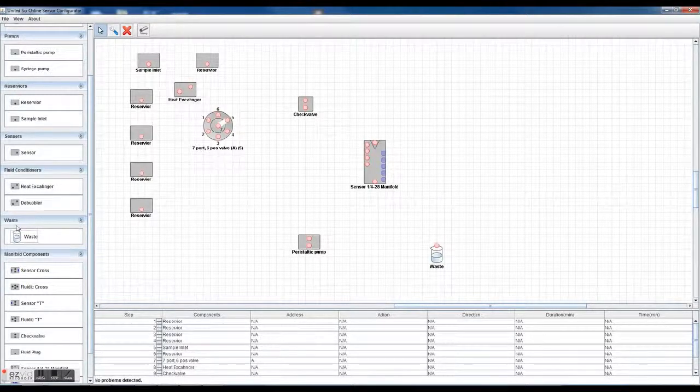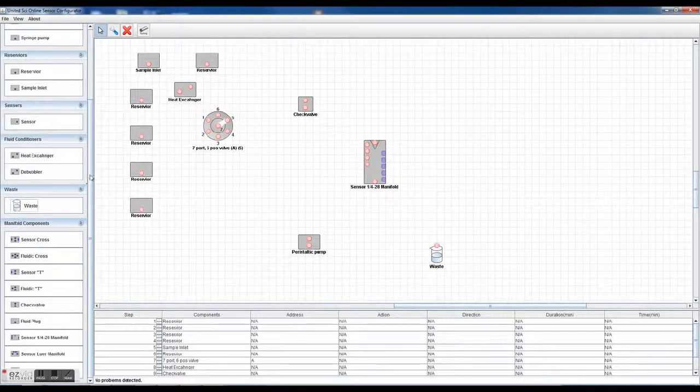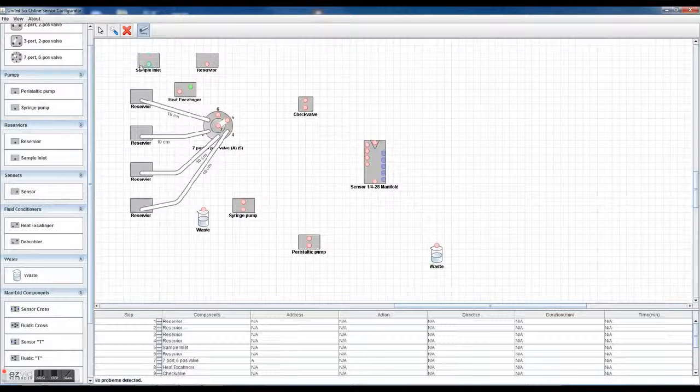If you have more than one peristaltic pump, maybe for an injection of, say, a colorimetric reagent or something like that, you can maybe put a syringe pump in there, maybe put some waste in there, okay? And then you plumb it all up with tubings, and of course each of these tubings and each of these reservoirs, all these components can be configured. I'll show you how to do that very quickly here.